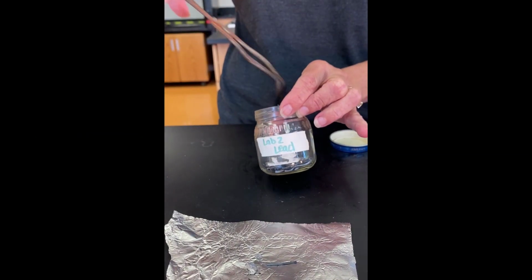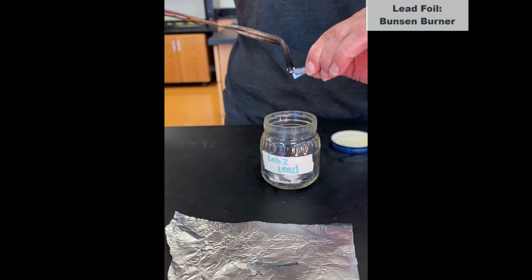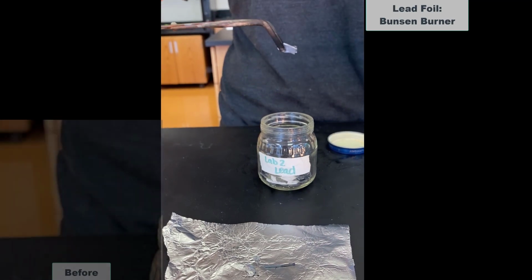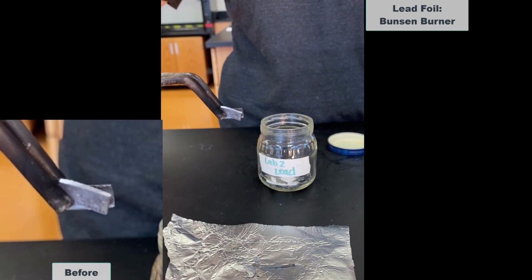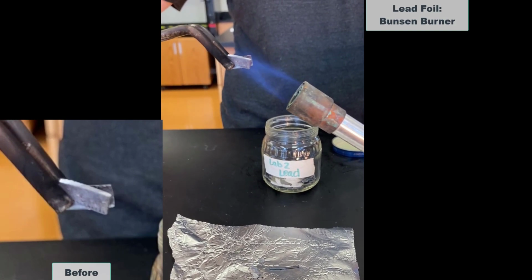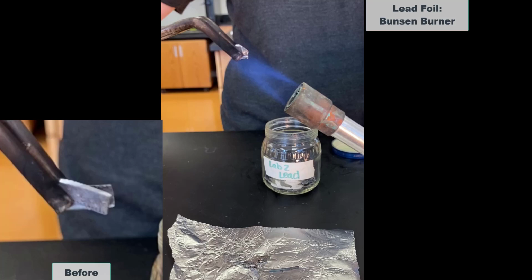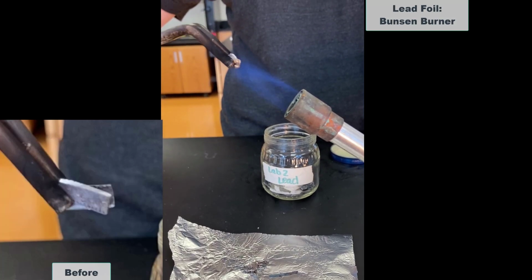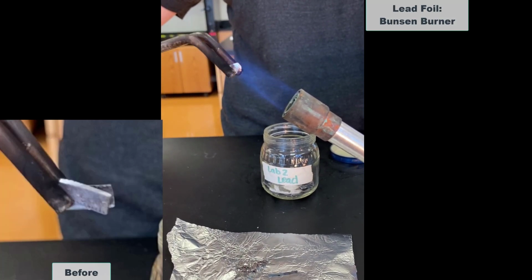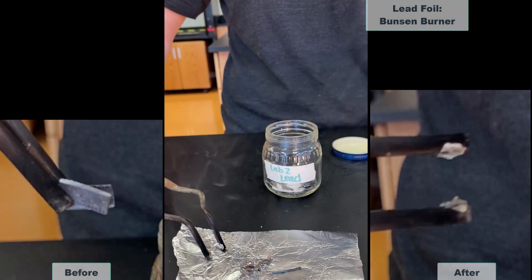Lead. Lead before. And there goes the lead. Clean that top. Oops, there goes my burner. And do a little light.